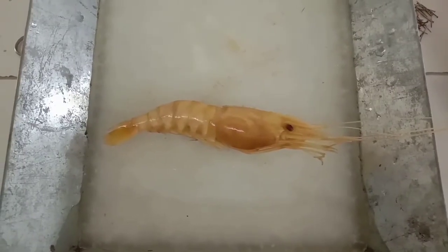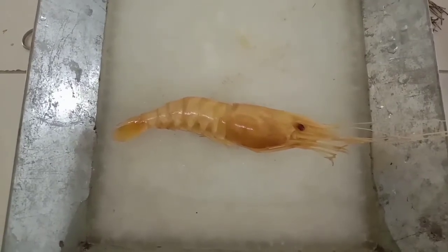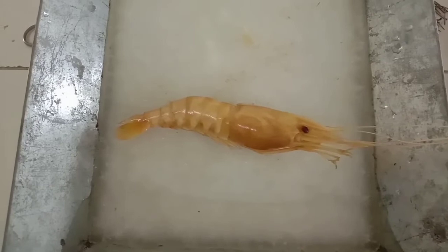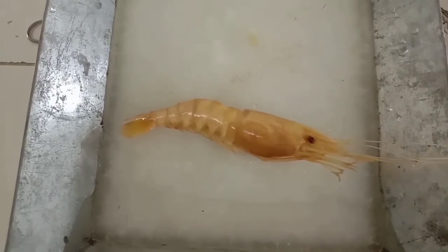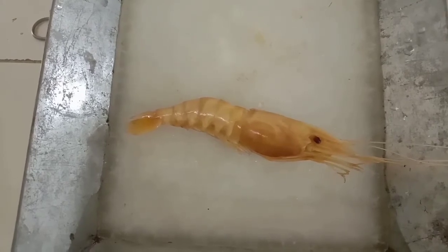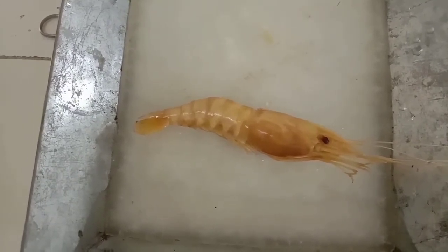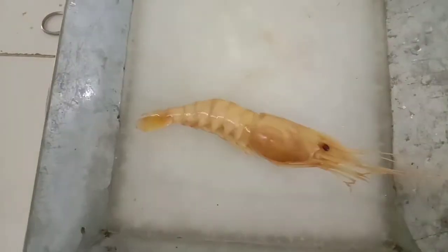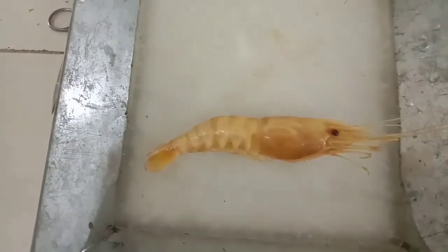Take a preserved specimen and lay it in a dissecting tray ventrally, with the dorsal surface facing upward to expose the ventral nerve cord together with the segmented nerve. The abdominal muscles should be cut through a median longitudinal incision from the dorsal side, and viscera in the thoracic cavity should be removed.